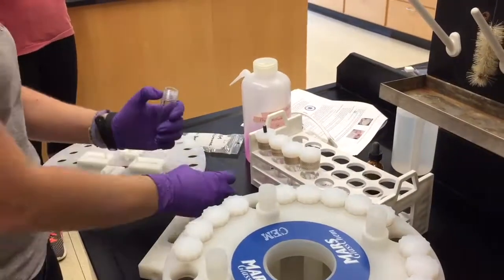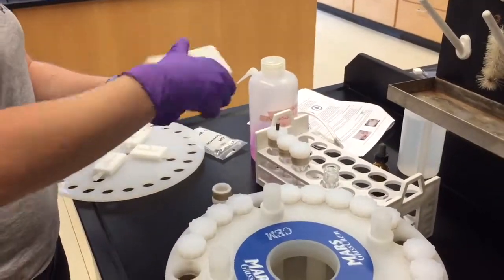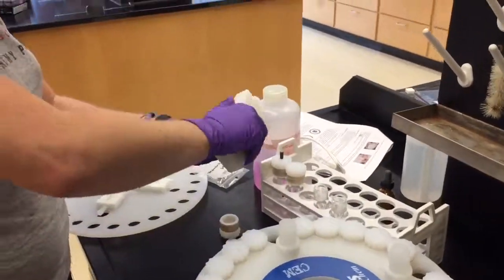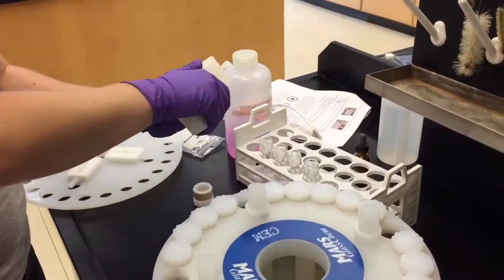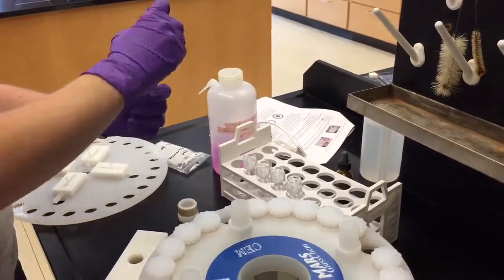Slowly open the vessels by having the top point towards the back of the fume hood. If the vessel top is rapidly loosened, the gases inside may escape quickly, causing a safety hazard. Perform the reaction workup.